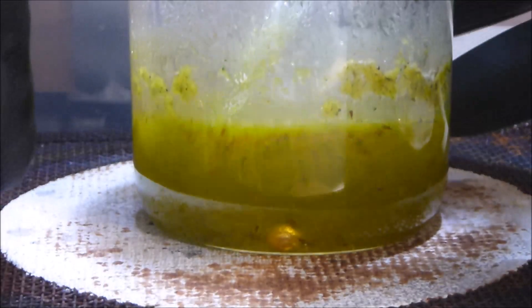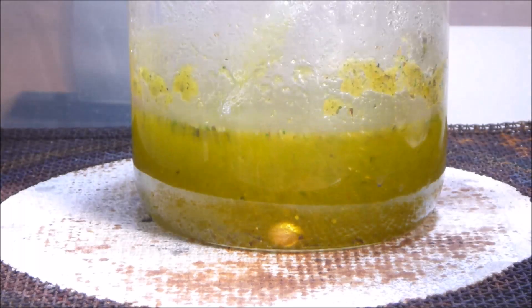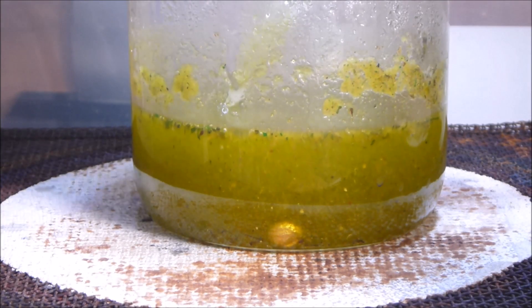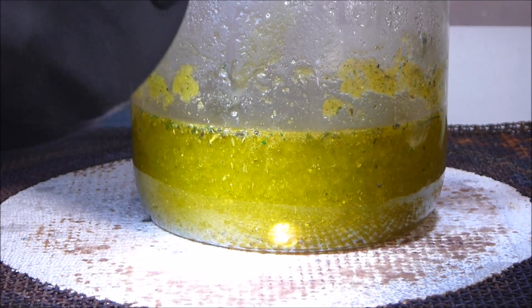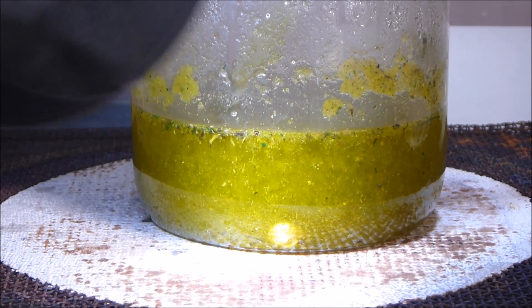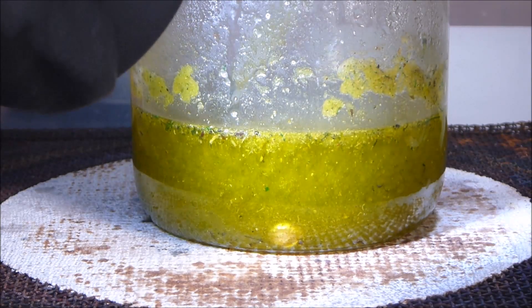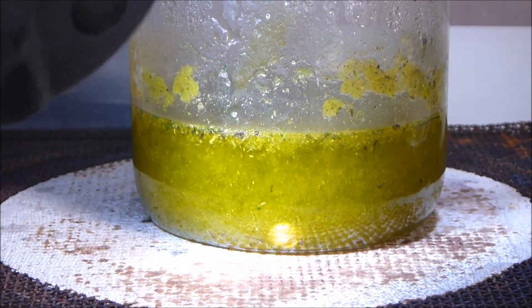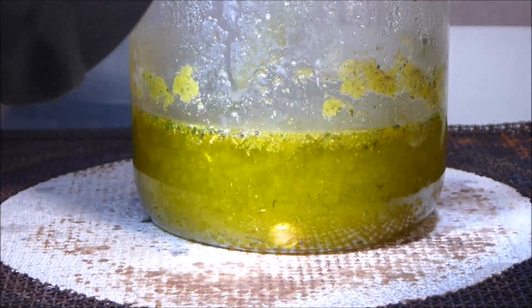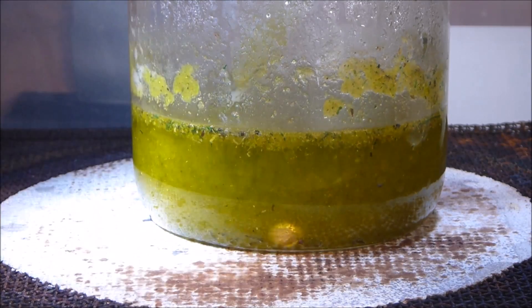What I'll quickly do is add some additional insulation — I'm just going to put another ceramic bed below that one — which should cool things down rapidly, as it has done. Bringing in some lighting, and yeah, absolutely no reaction there with the gold button. I'll keep this solution around the 90 degree Celsius range for a little longer and check on it again in about 10 minutes.